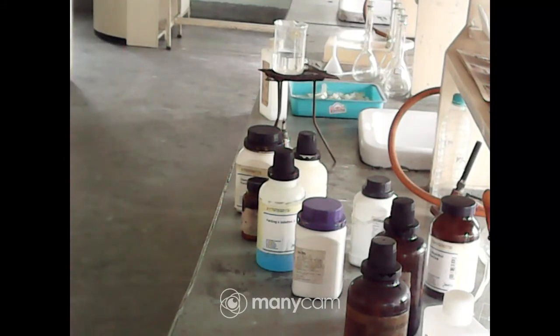So what we have done is 2 tests for carbohydrate and 2 for protein. For carbohydrate, first of all the alpha naphthol solution, and next the Fehling solution, and for protein it is the biuret test and the ninhydrin test. Okay, so that is all about the experiment. Now you have to write it in your laboratory notebook. Clear?